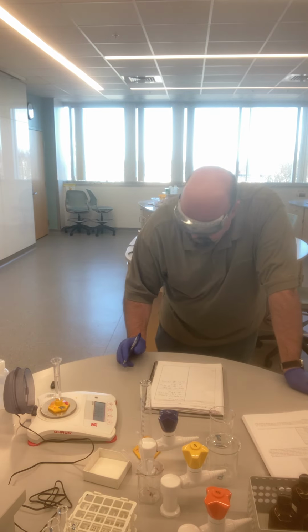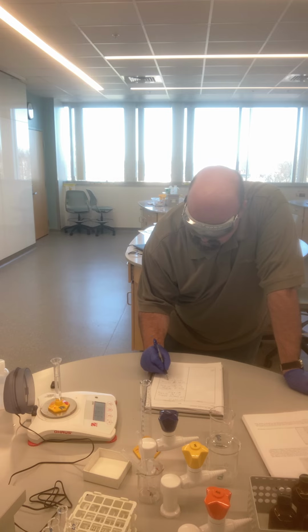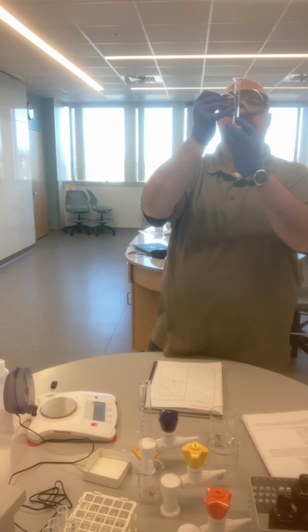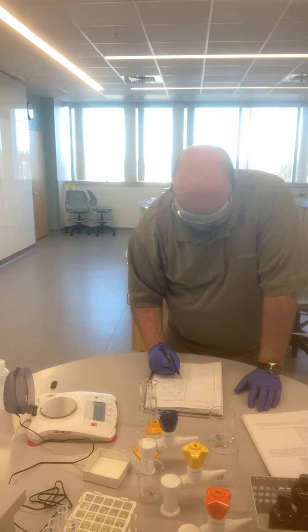Added some of liquid 3. So the cylinder plus liquid 3 is 37.913 grams with a volume of 9.6 milliliters.